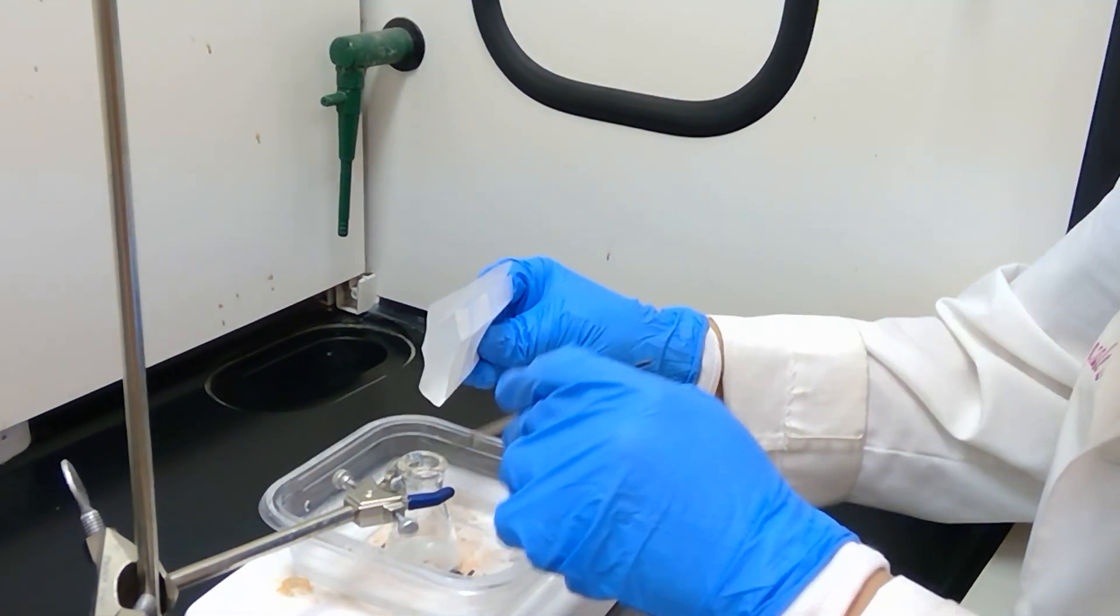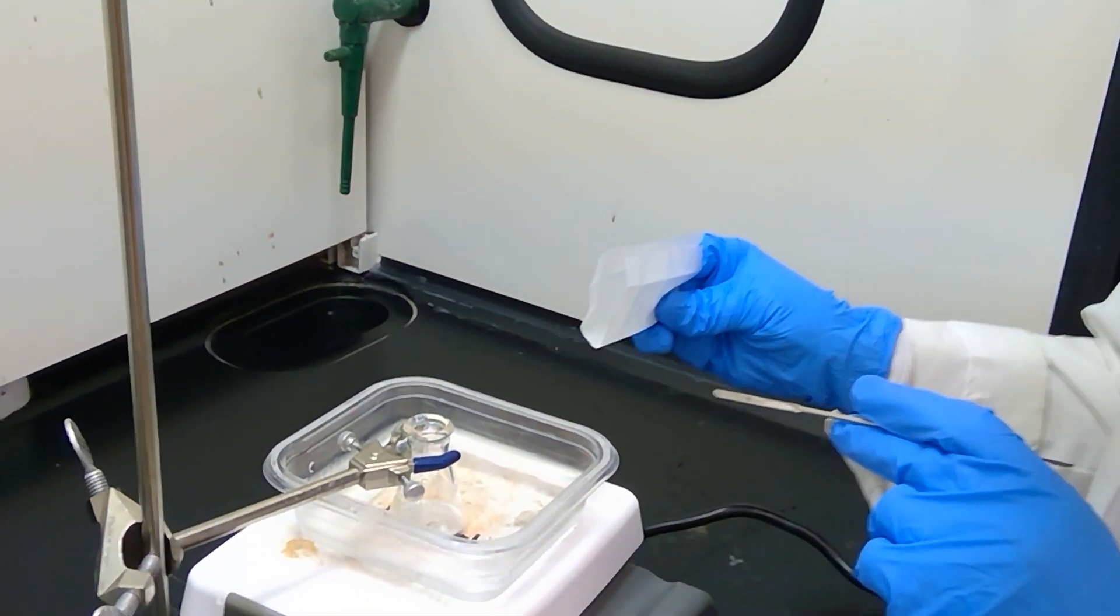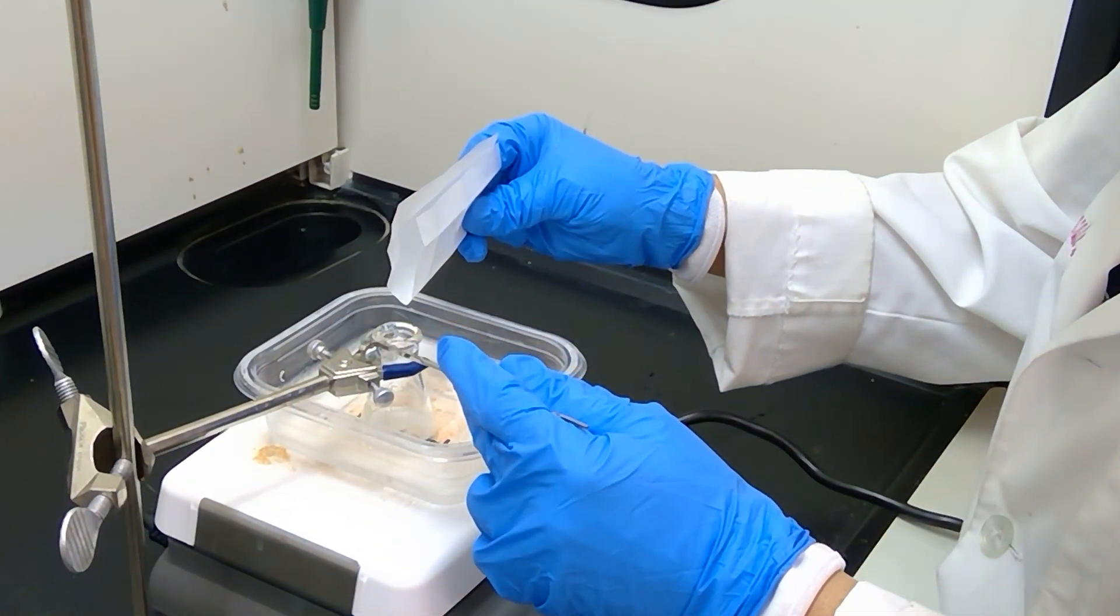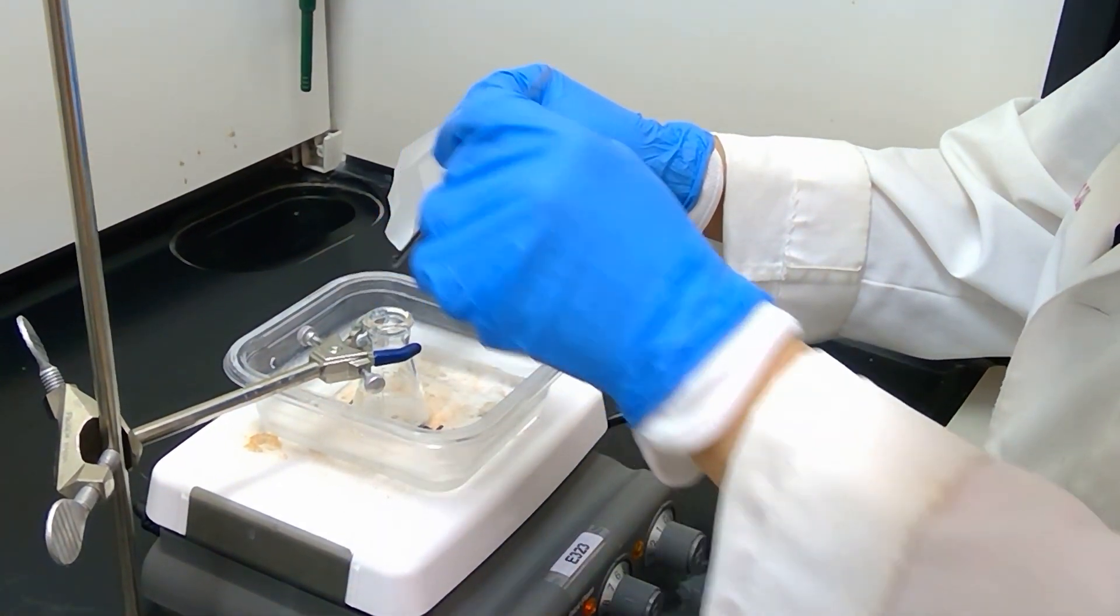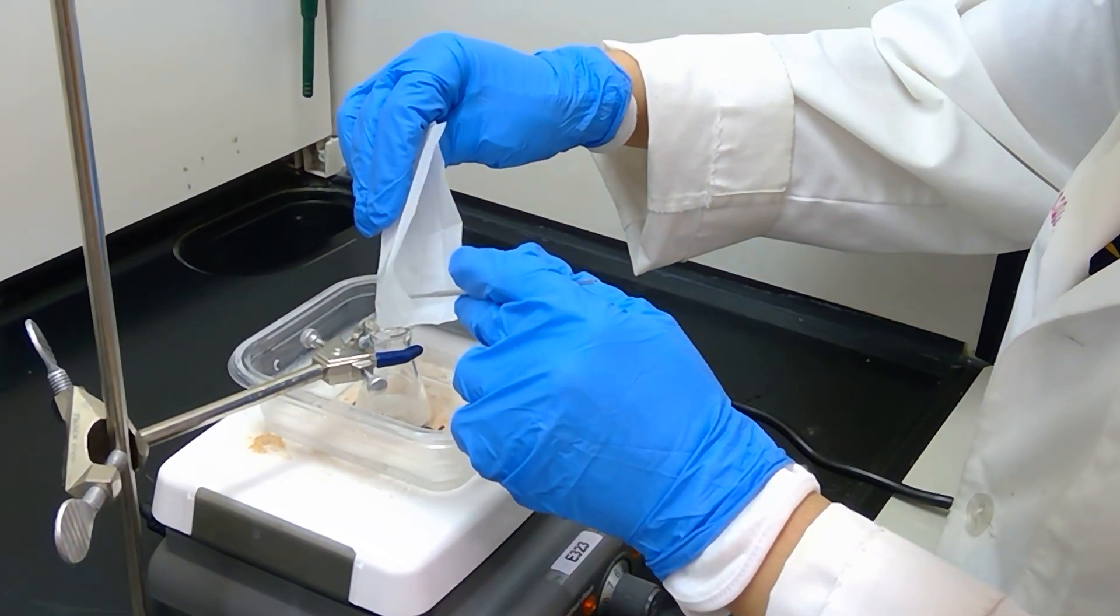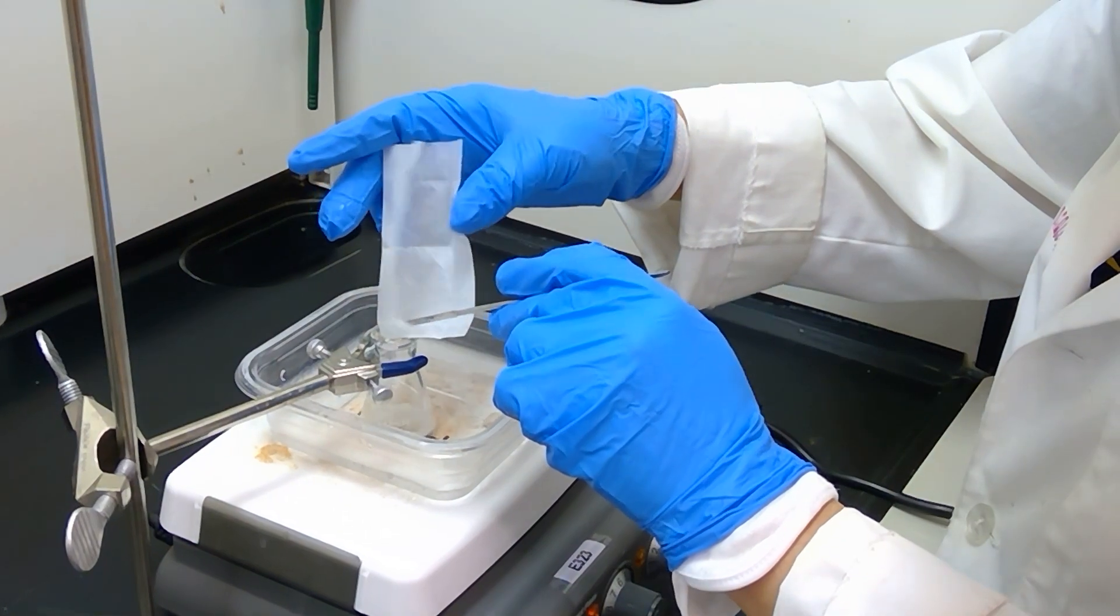At the bottom we will see that we are creating a little bit of a milky substance with some white coloring going on, and that's a good sign because our compound should be a white solid that we isolate at the end.